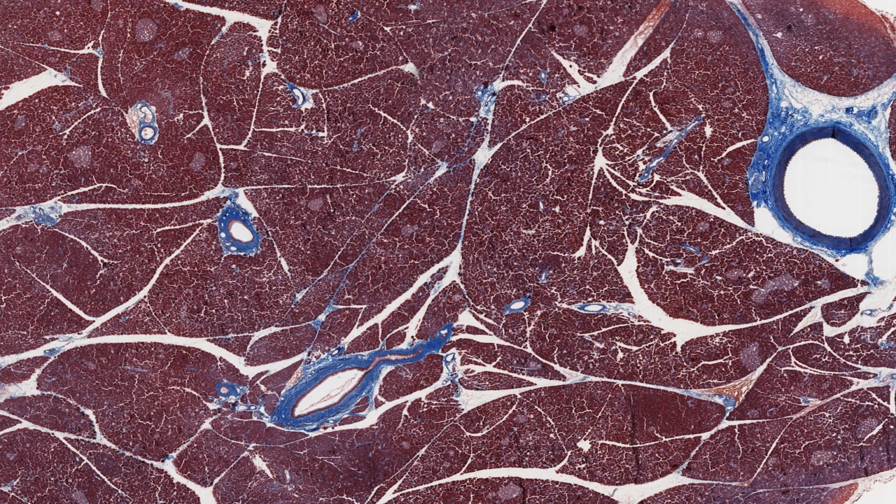The pancreas demonstrates several further glandular features of interest. First, it's actually two glands in one. Most of the tissue is a compound acinar exocrine gland, with acinar secretory units and ducts. This exocrine portion makes up the darker staining bulk of the lobule. However, it also includes clusters of endocrine cells.